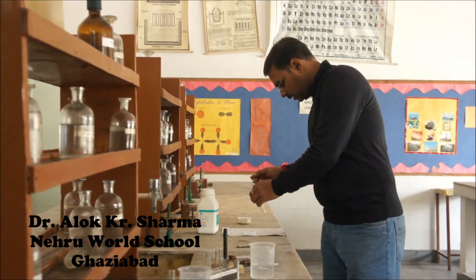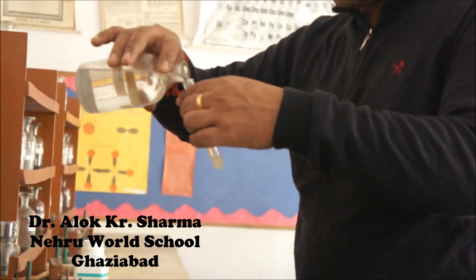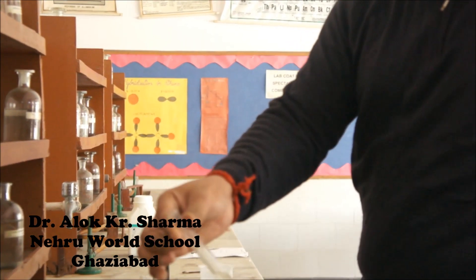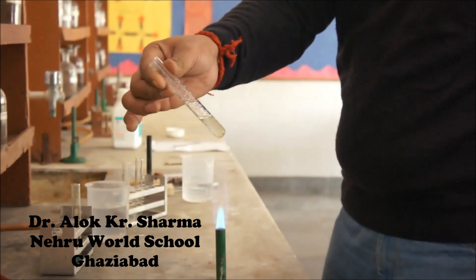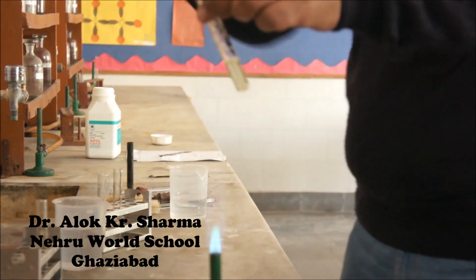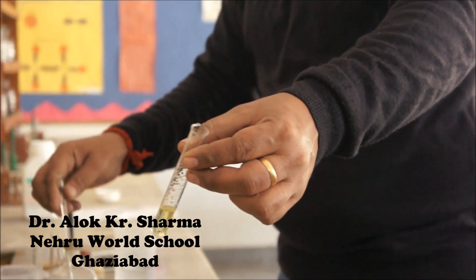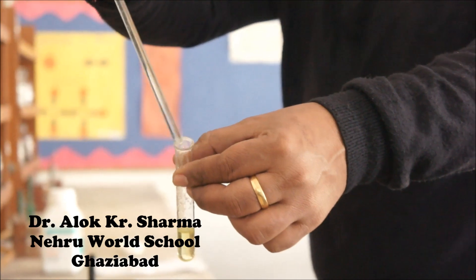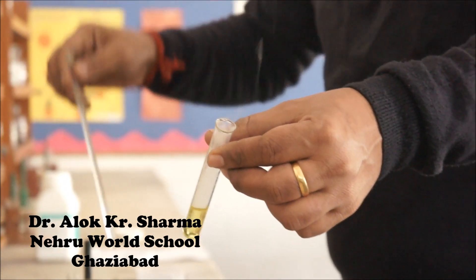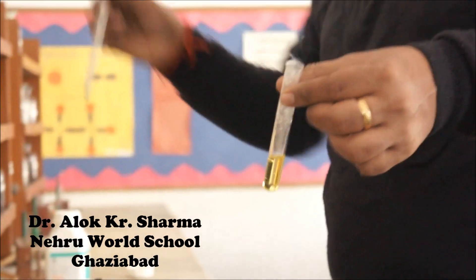So, we take salt and add concentrated H2SO4 to it. A colorless gas comes out with a very pungent odor. The gas is HCl. When this gas comes, because it is HCl, a pungent gas, bring the glass rod dipped in NH4OH, so white fumes come out. White fumes confirm the presence of Cl minus. This is the first test of chloride.